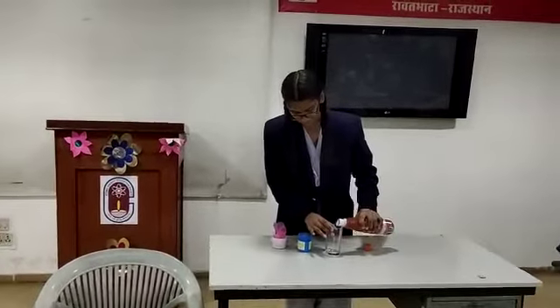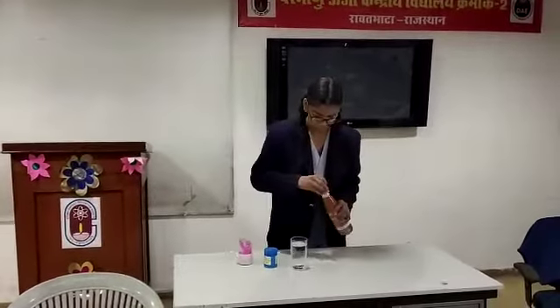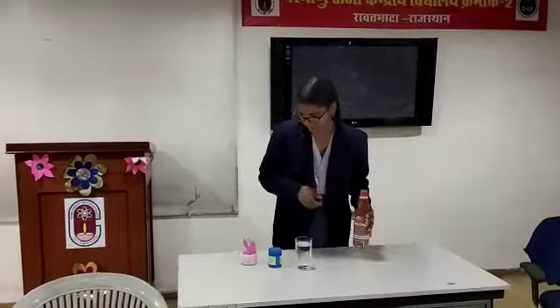I am taking some vinegar in the beaker and adding some water to it so that it is clearly visible. Then I am adding some colour to it so that it is clearly visible.